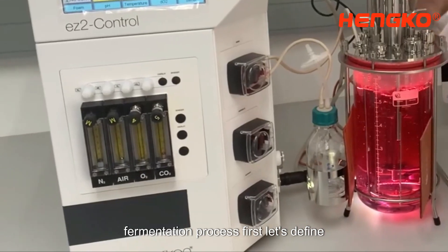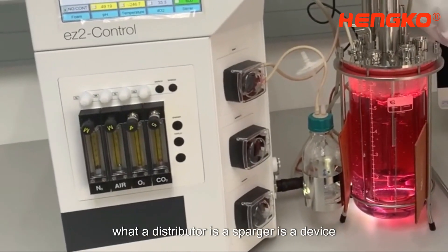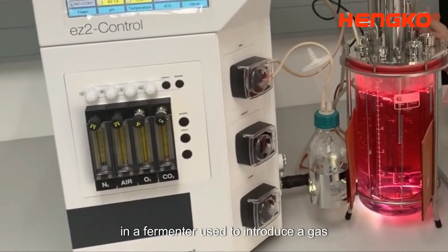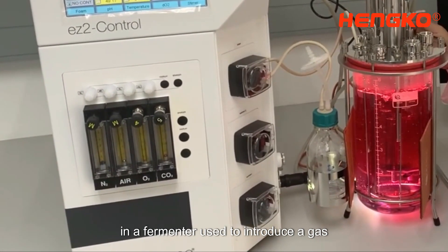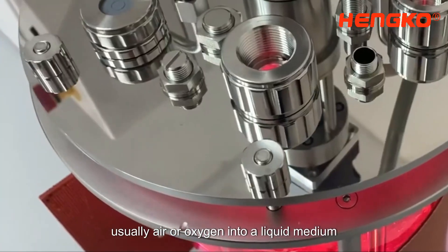First, let's define what a sparger is. A sparger is a device in a fermenter used to introduce a gas, usually air or oxygen, into a liquid medium.